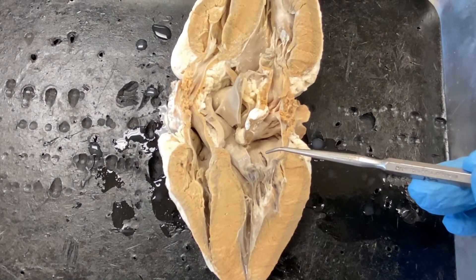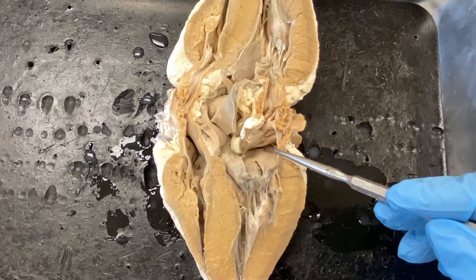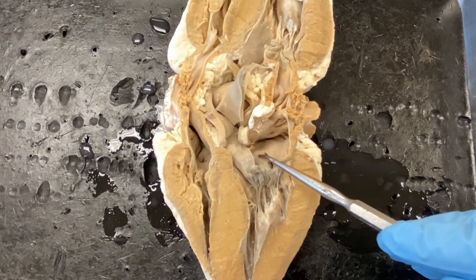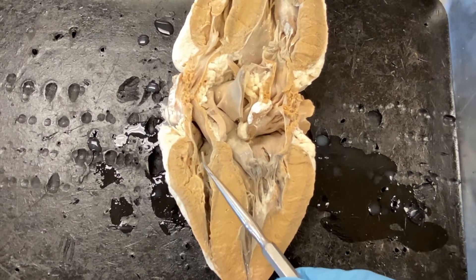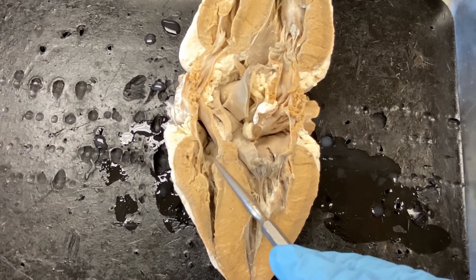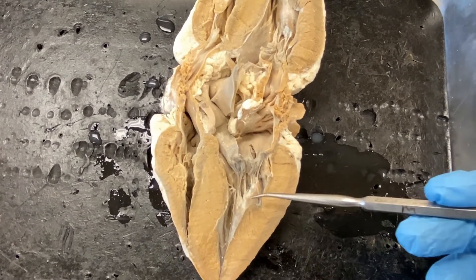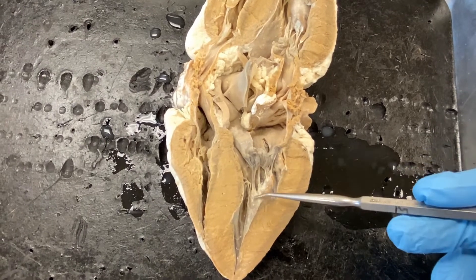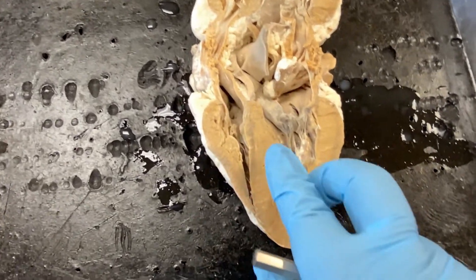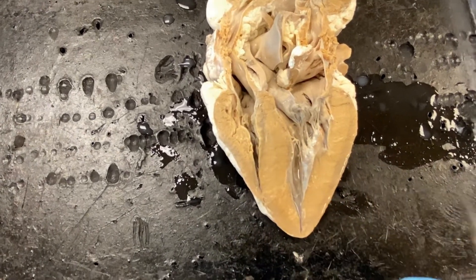Next, we will look at the valves and associated structures. The valve at the junction of the left atrium and left ventricle is the mitral valve or bicuspid valve. The valve at the junction of the right ventricle and right atrium is the tricuspid valve. Valves are connected by the chordae tendineae. At the base of the chordae tendineae there will be the papillary muscles. Tracking more interiorly toward the wall, there will be the trabeculae carneae.